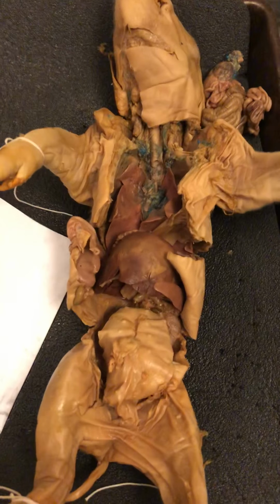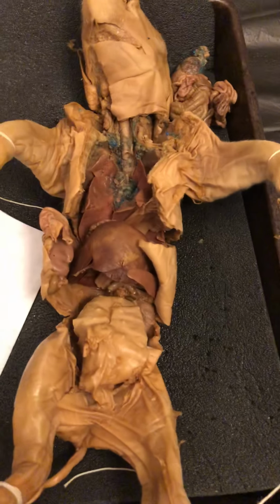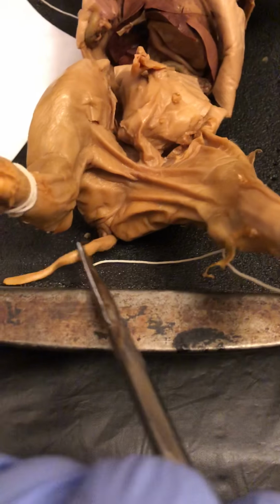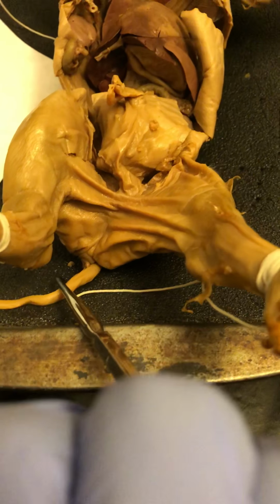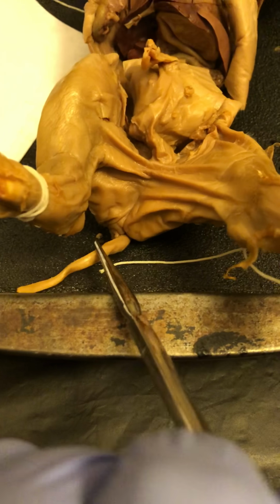We are going to be discussing the reproductive system. And so basically the first thing to do is to identify the sex of the pig. So I'm actually going to go to the bottom of the fetal pig, and the tail is actually inferior to the genital papilla, and that is a direct indicator that I have a female.